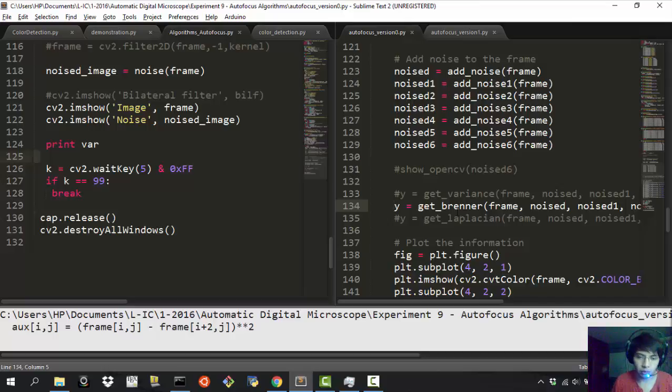We have a very reduced one, and as you can see, it reduces to finding the maximum at 8 or 10 points, and that's more than enough for an exhaustive search algorithm, for the British Museum algorithm. You know that it doesn't get very complicated until you get to the 10,000 values. So just getting from 10 to 30 values is enough for finding the autofocus. And okay, this algorithm just takes a while. The computer is not that fast, but I just wanted to explain that. And as you will see, it works very well. And we'll go with that.